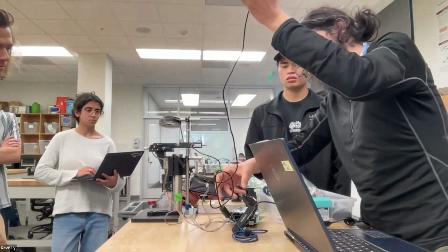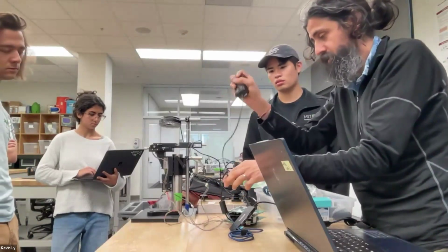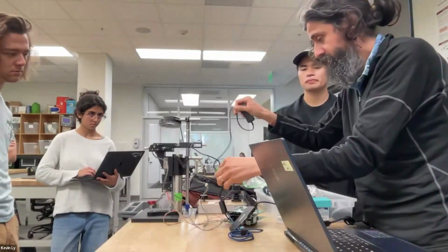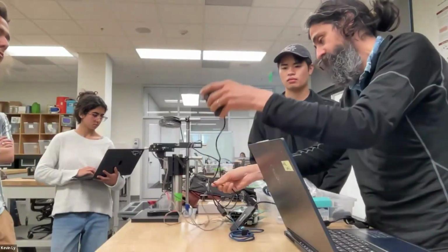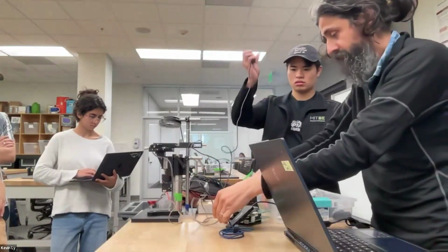And then Hannah is on her way, and then she'll spend some time walking through and doing some demos for this. But on the history side, if you look at that PDF, you'll start seeing what we realized is that we started building these modules. And then these modules come together to build microscopes.